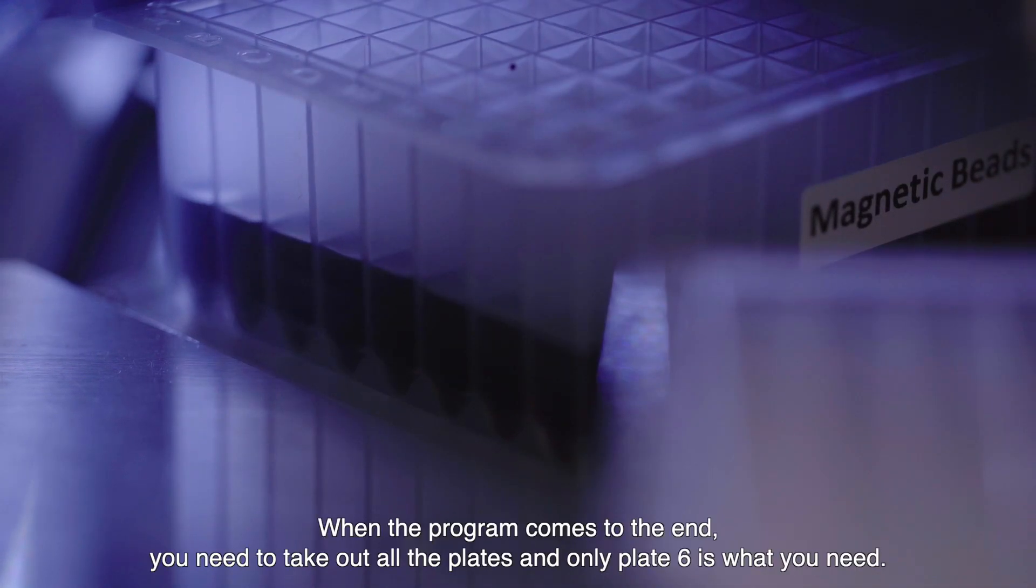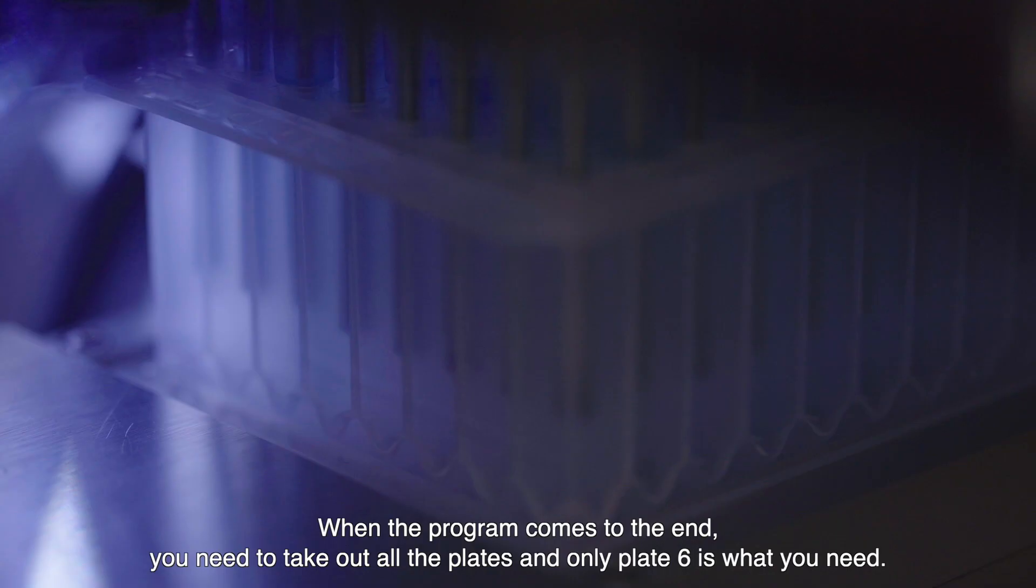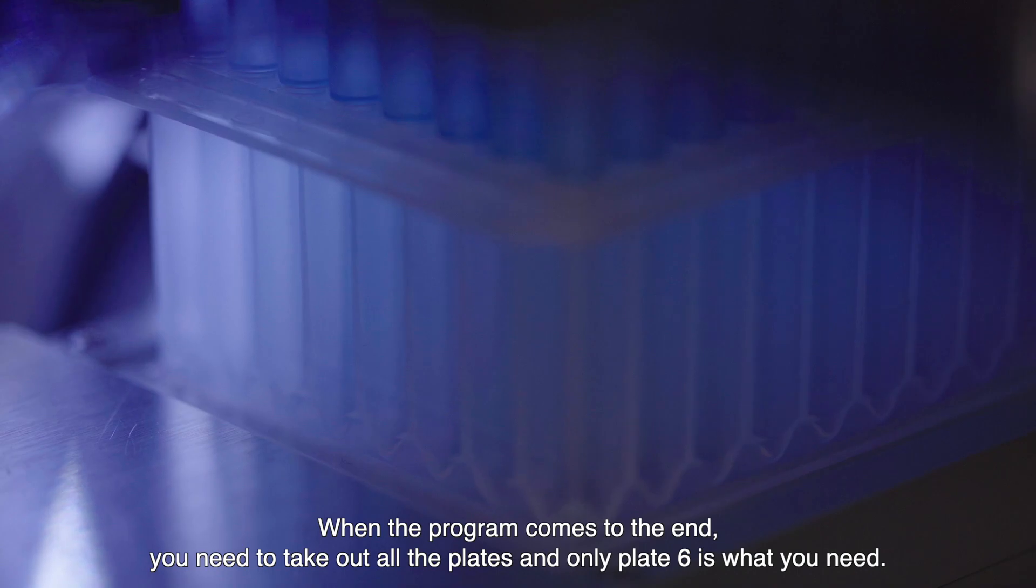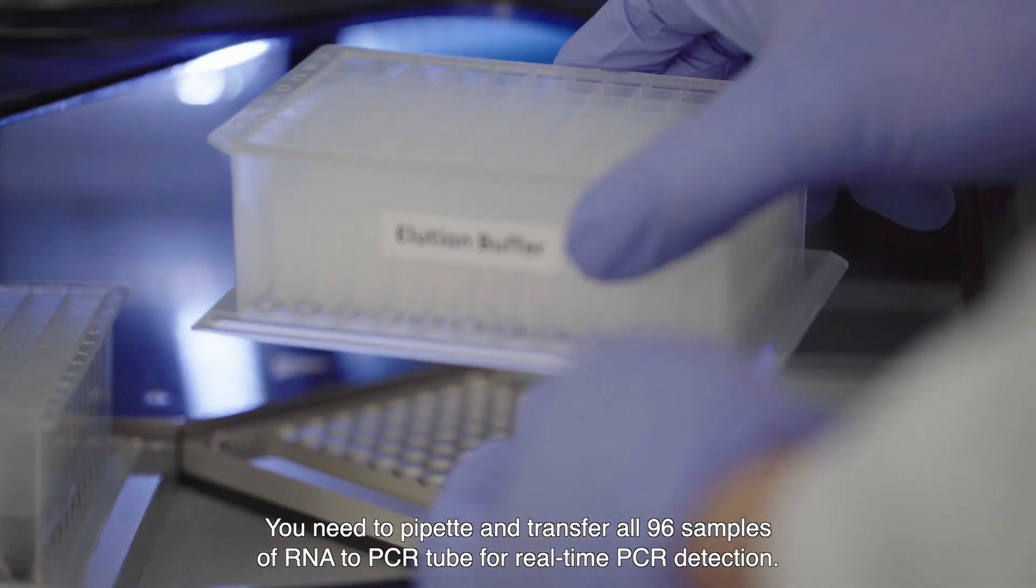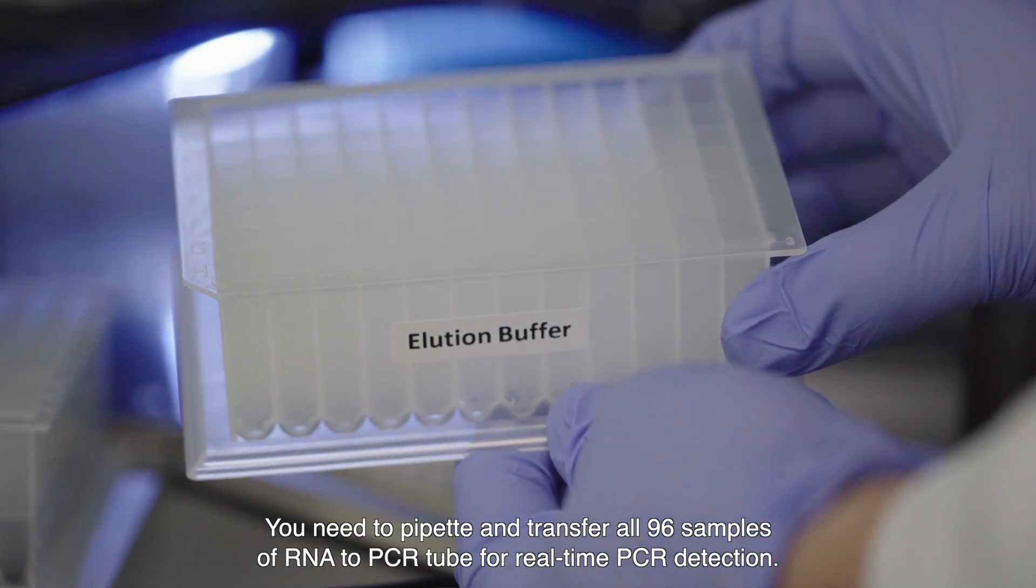When the program comes to the end, you need to take out all the plates and only plate 6 is what you need. You need to pipette and transfer all 96 samples of RNA to PCR tubes for real-time PCR detection.